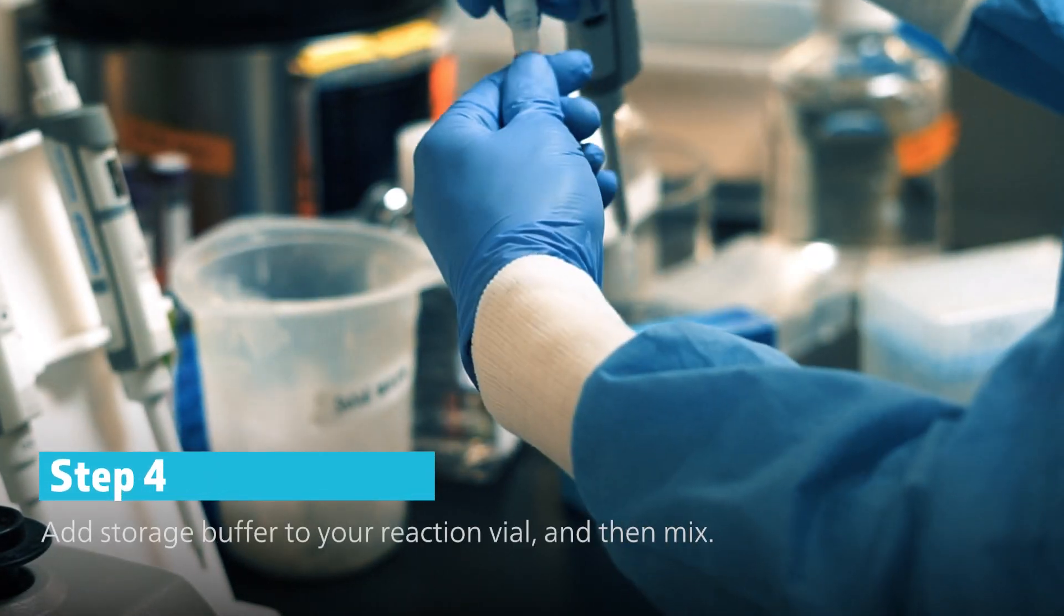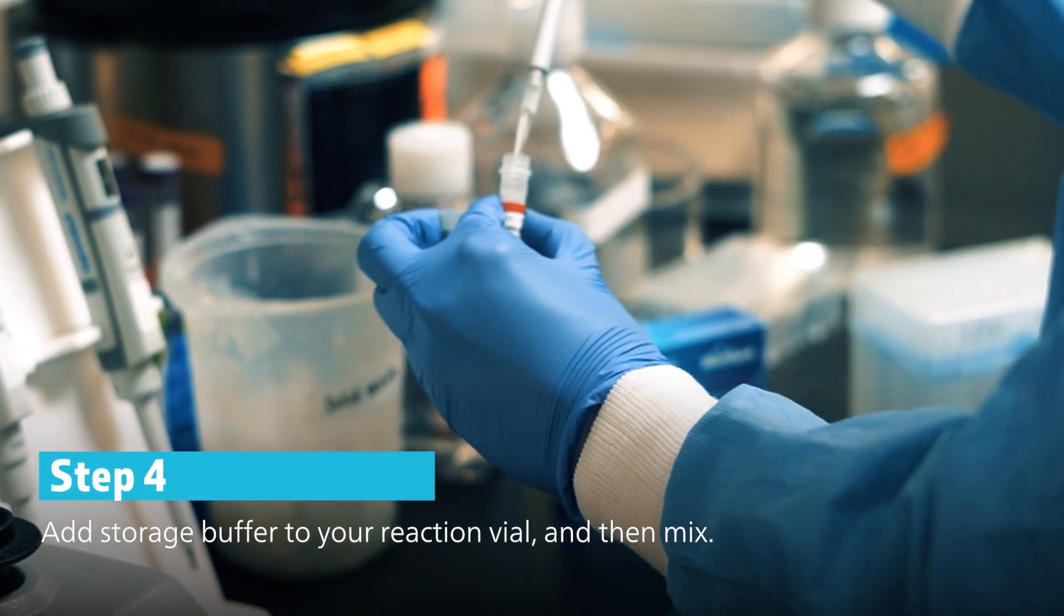Lastly, add storage buffer to your labelling reaction. And you're done.